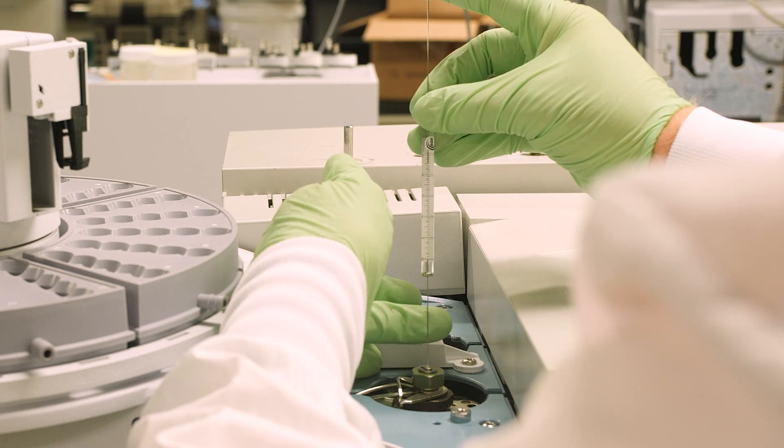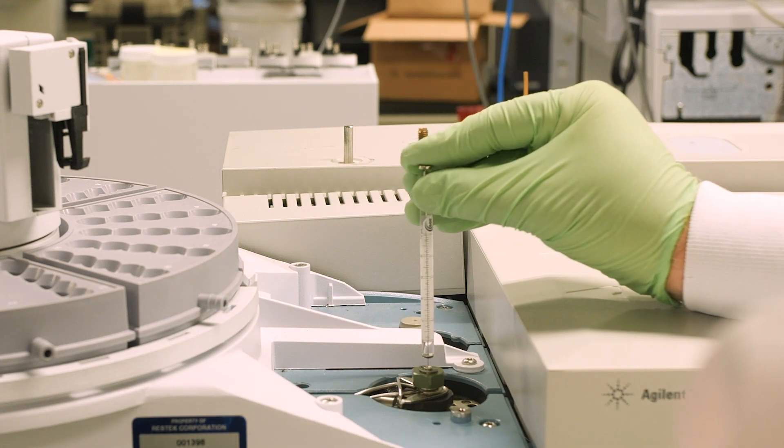Finally, remember to guide the needle either by hand or using a syringe guide. This helps you maintain the insertion angle, reducing the chances of bending the needle.